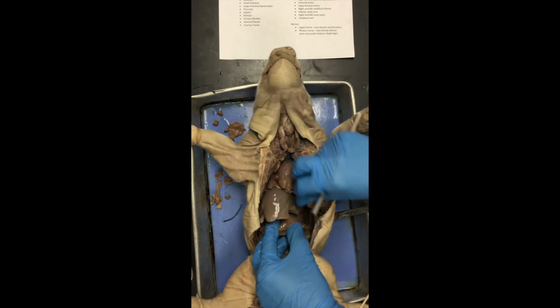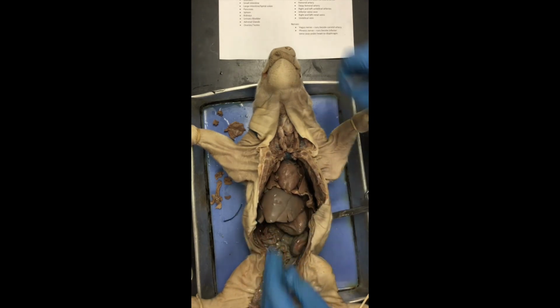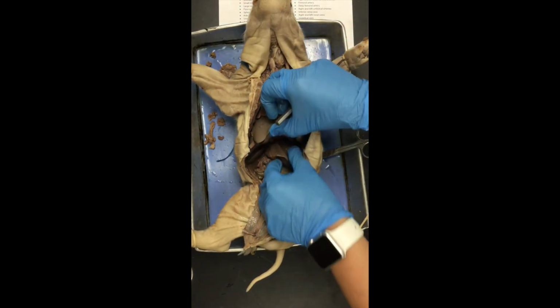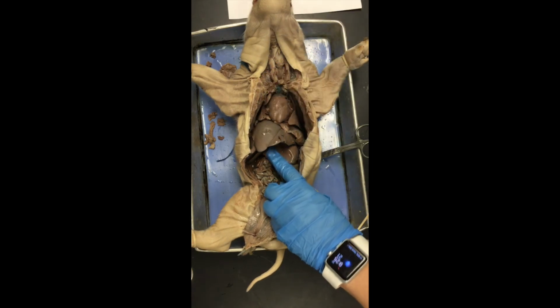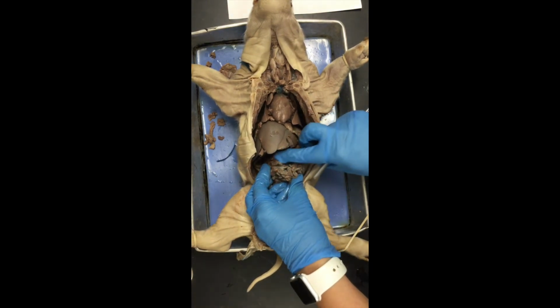The stomach is this kind of balloon or deflated balloon-like structure right here. I'm going to pick up a little bit so you can see it a little bit more clearly. There we go. This little balloon-like pouch, kind of squishy, that's going to be the stomach that's there, okay? All of this that's very tightly coiled, that's the small intestine.